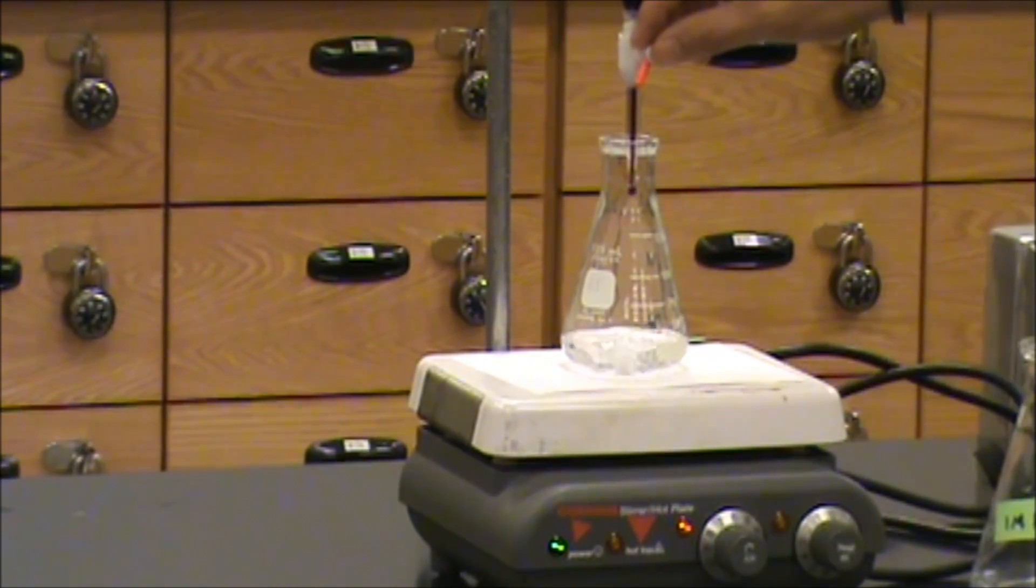We want to pinpoint this endpoint down to a single drop of titrant added in order to get the most accurate measurement possible. And so we're looking for a faint pink color, faint purple color.